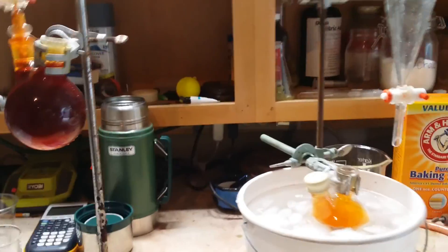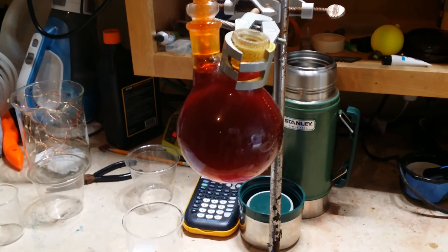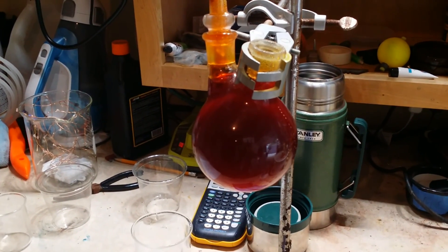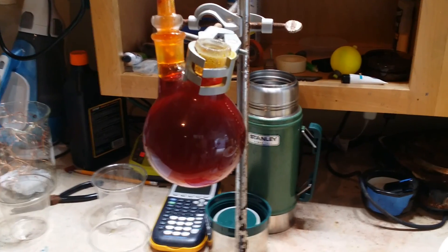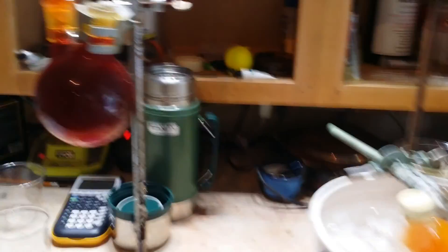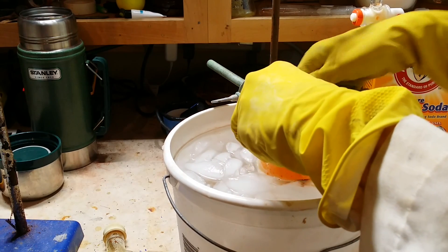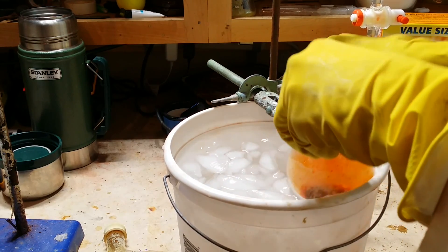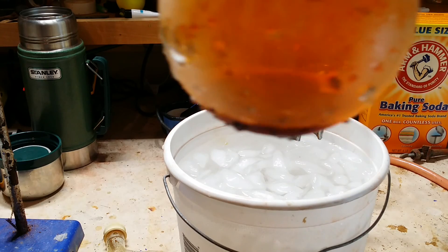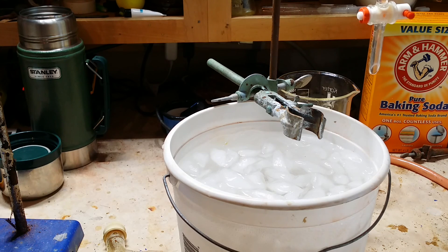I've just put my respirator on since I've disconnected the condenser tube. The reaction is complete, though there's still quite a bit of bromine in the reaction flask — I can dispose of that by using copious amounts of water and sodium bicarbonate, which will neutralize it back to sodium bromide and make the solution non-hazardous. Let's take the collection flask. There's our bromine in there. It's a little bit difficult to see, but there's a clear layer above the bromine — that's water. Our next step is to separate it from the water.